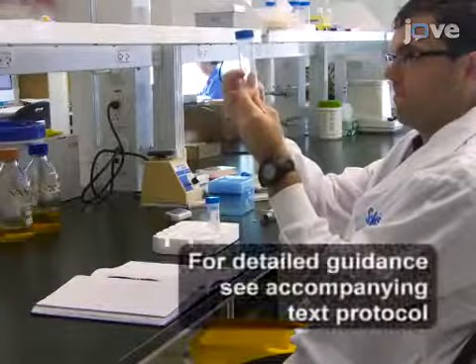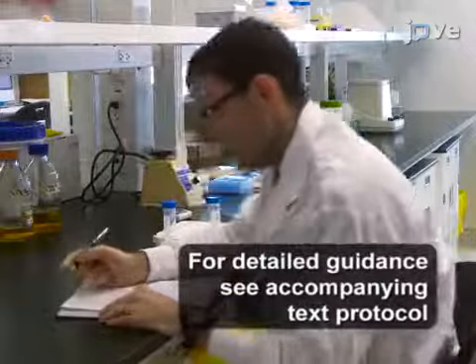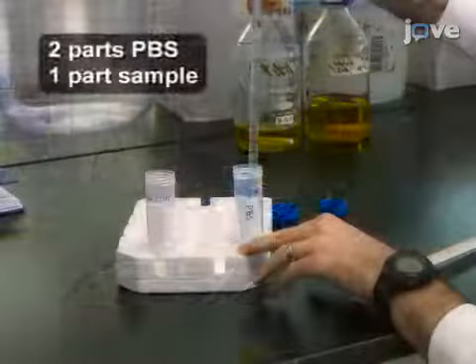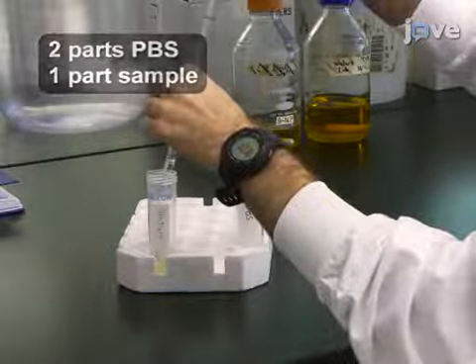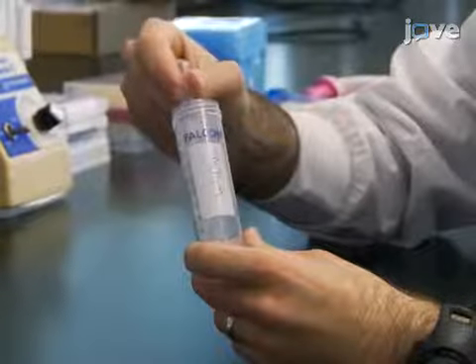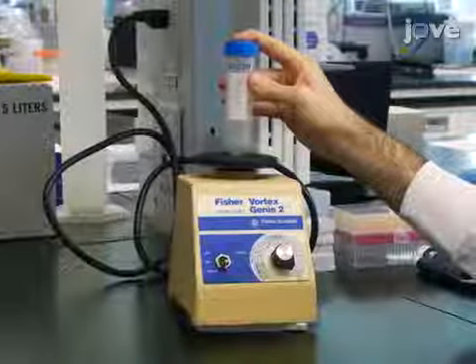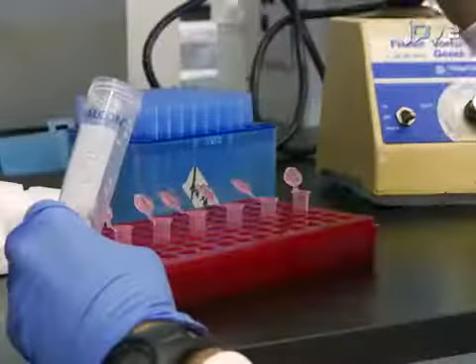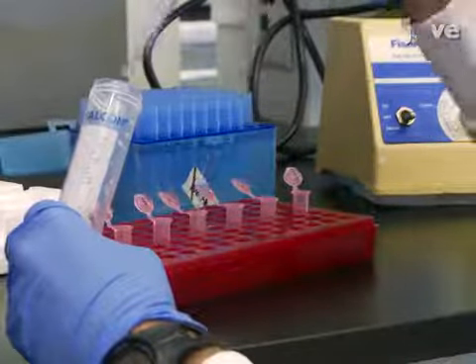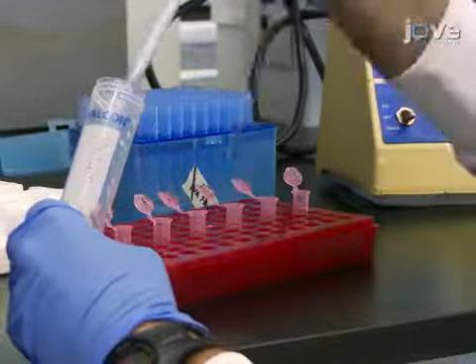To begin the experiment, record the volume of the previously obtained sputum sample. Add phosphate buffered saline, or PBS, at 2 times the volume of the sample. Next, use a transfer pipette to thoroughly mix the sample. Vortex the sample on the highest setting for 1 minute to mix it completely. Aliquot 1 milliliter of the mixture into 1.5 milliliter microcentrifuge tubes.